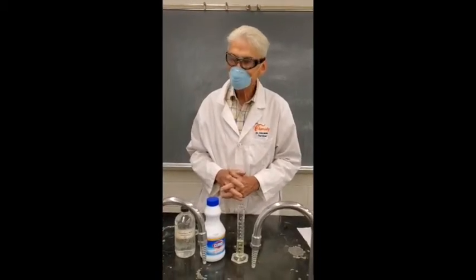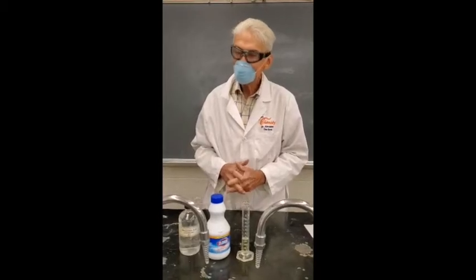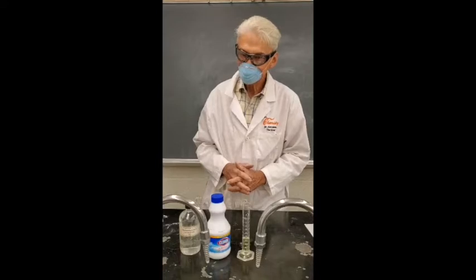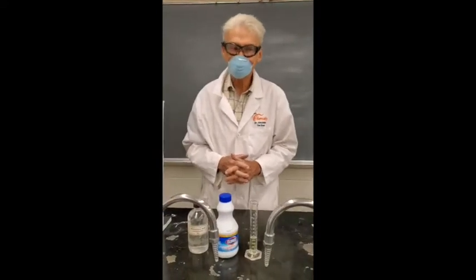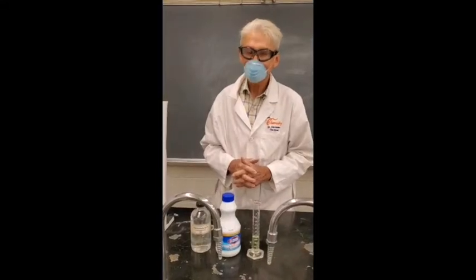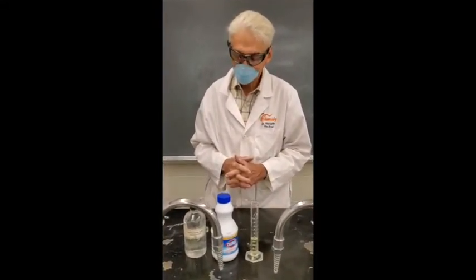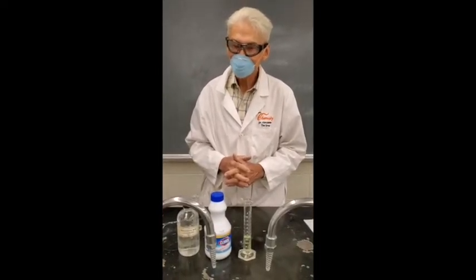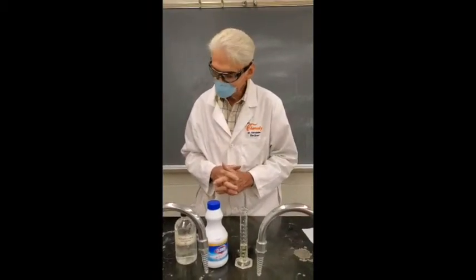Okay, and we're going to study 3 of them: chlorine, bromine, and iodine today. The first one we're going to make is chlorine, which is a gas, and all these compounds are colored. Fluorine is a yellow gas. Chlorine is a greenish yellow gas. Bromine forms a brownish orange vapor, and iodine forms a beautiful violet vapor.